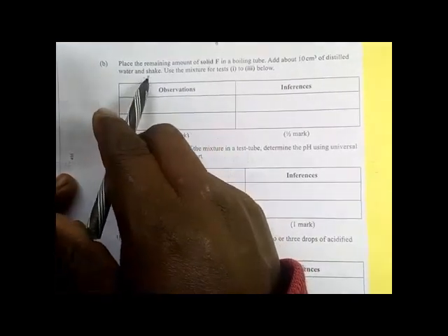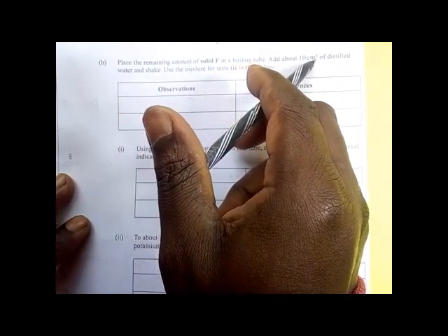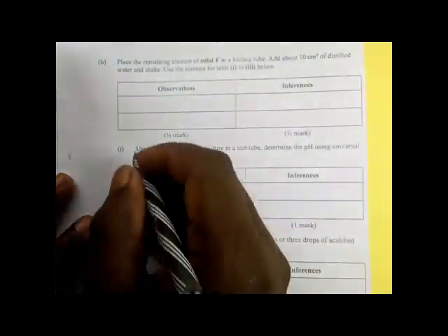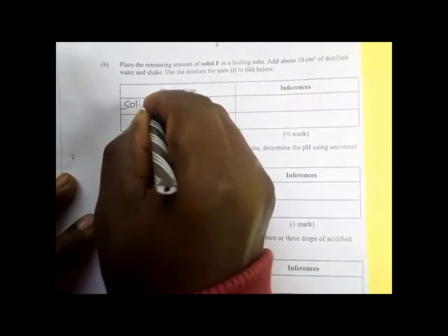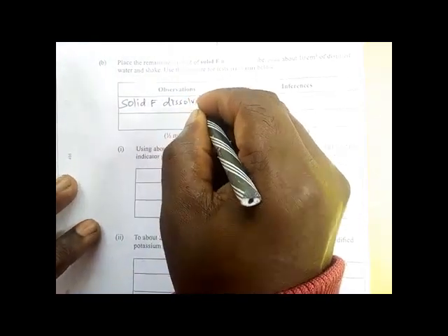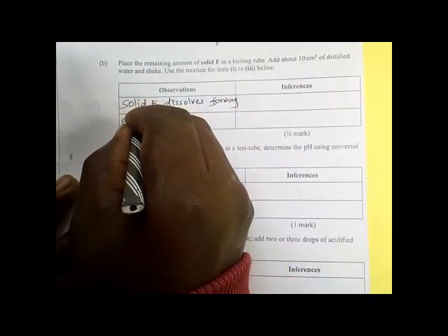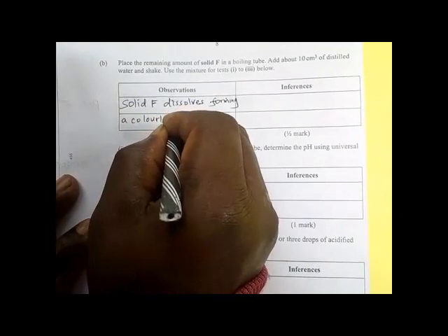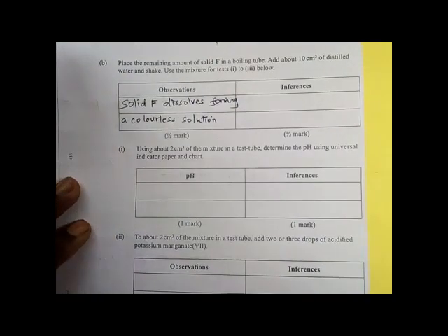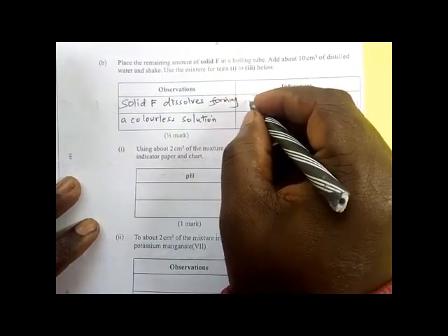Place the remaining amount of solid F in a boiling tube, add about 10 cm³ of distilled water and shake. Use the mixture for tests Roman one to Roman three. The solid F dissolves forming a colorless solution. That means that the solid is a polar organic compound — a polar organic compound is a compound which dissolves in water; the one which does not dissolve is called non-polar.